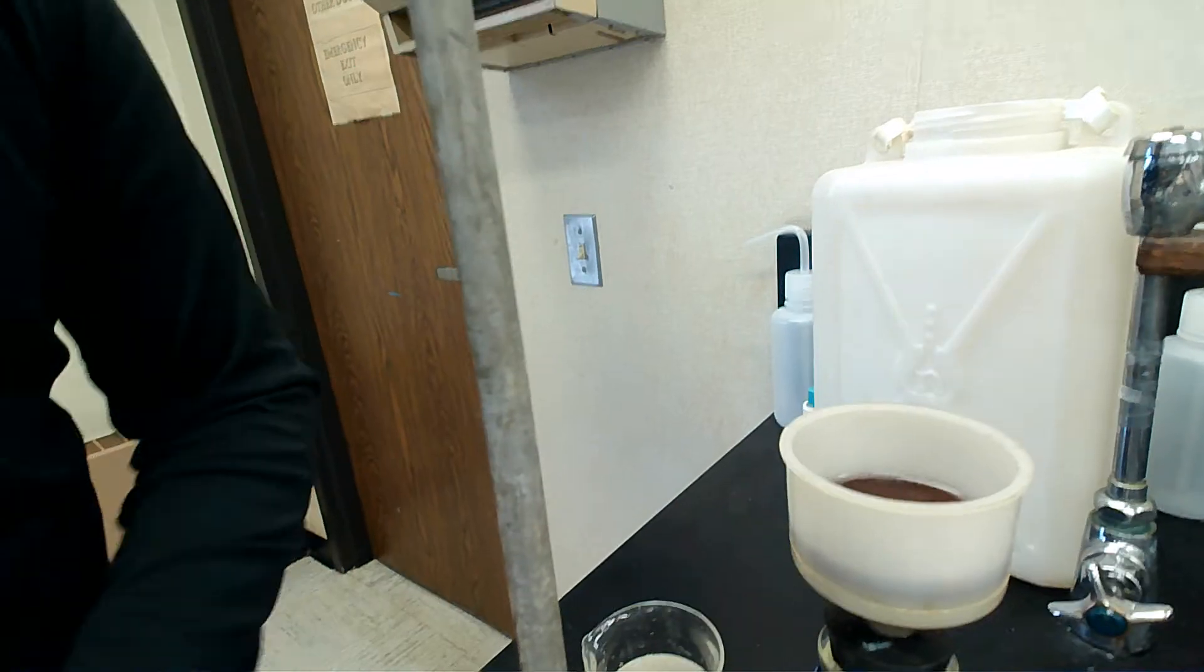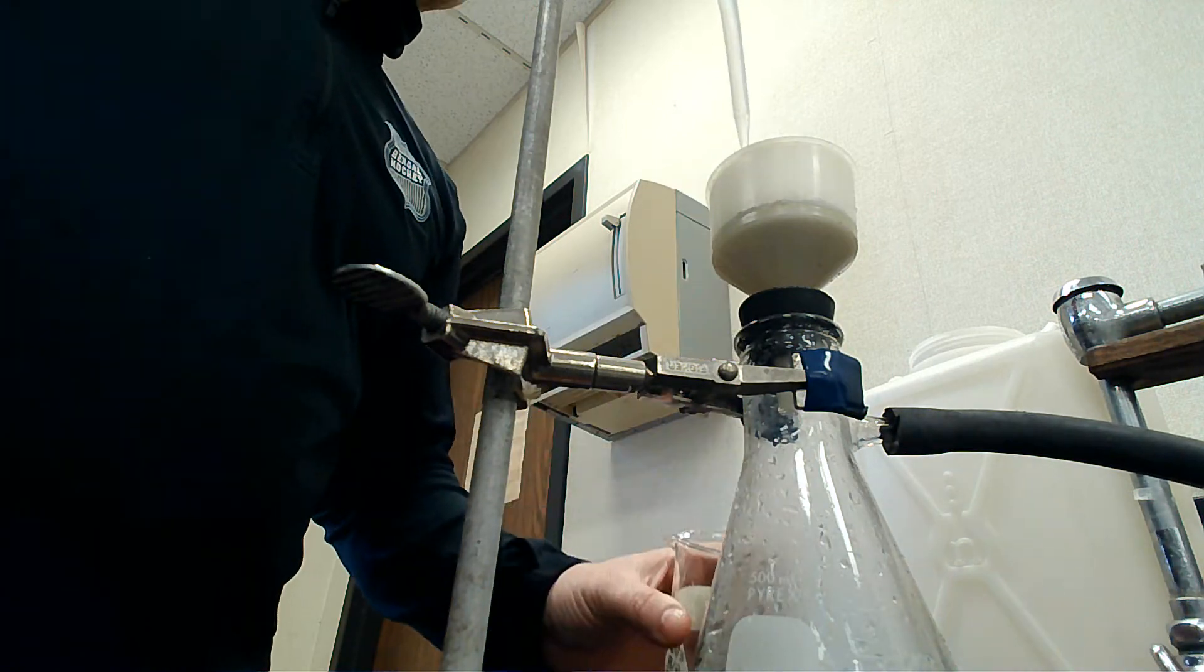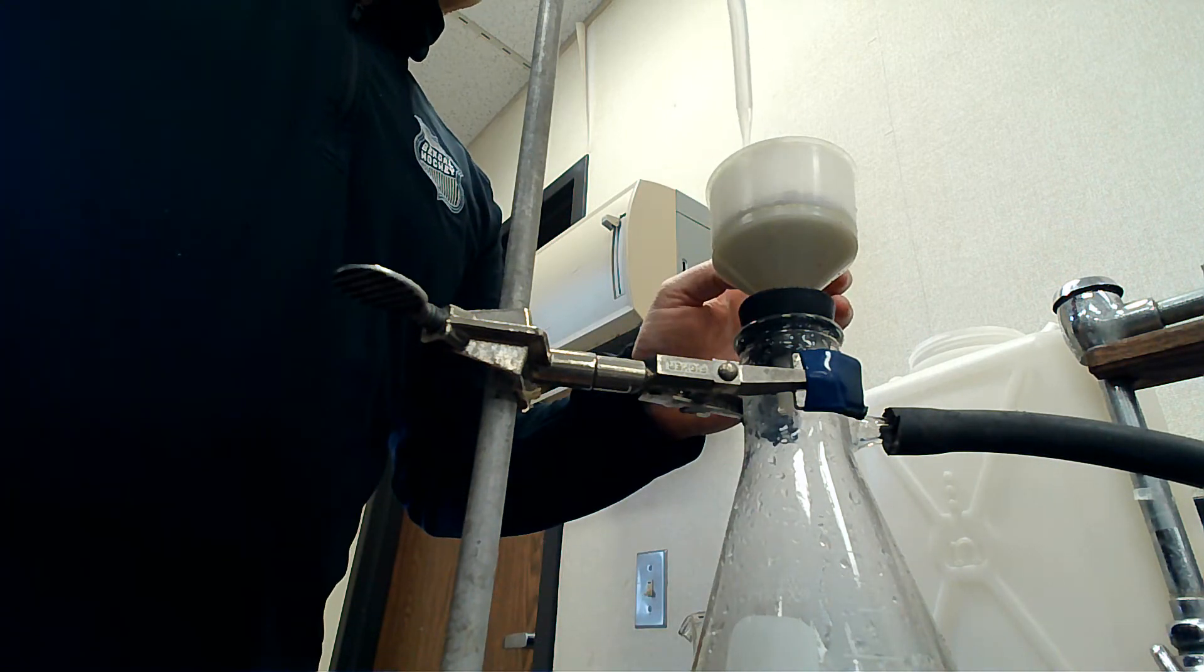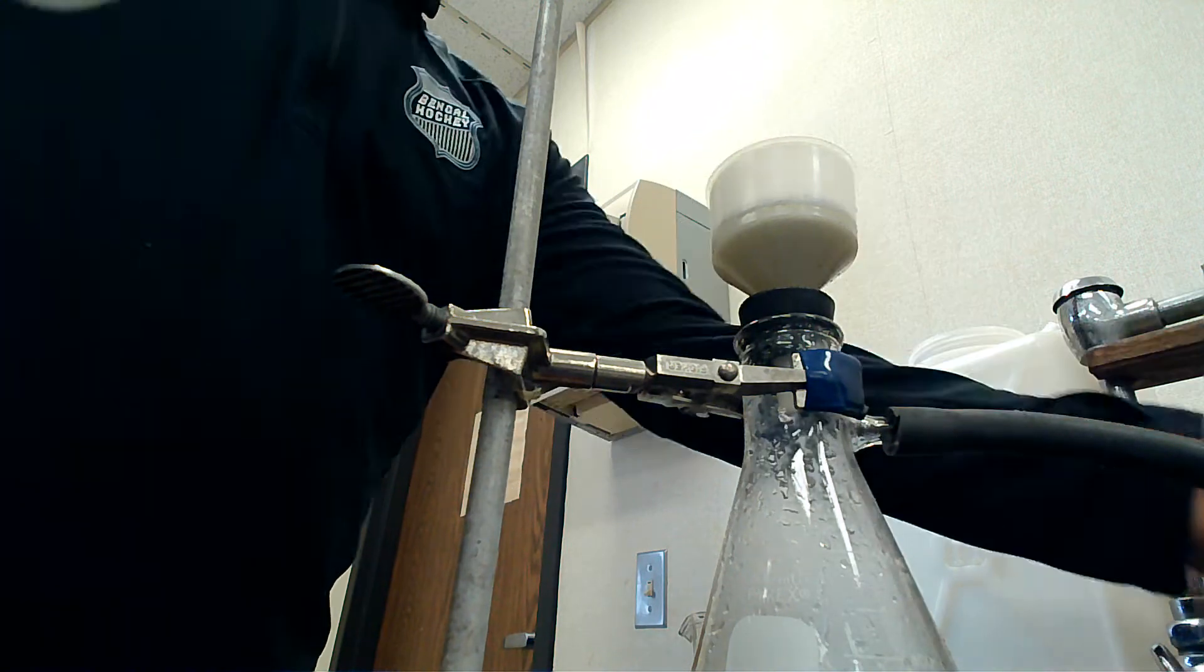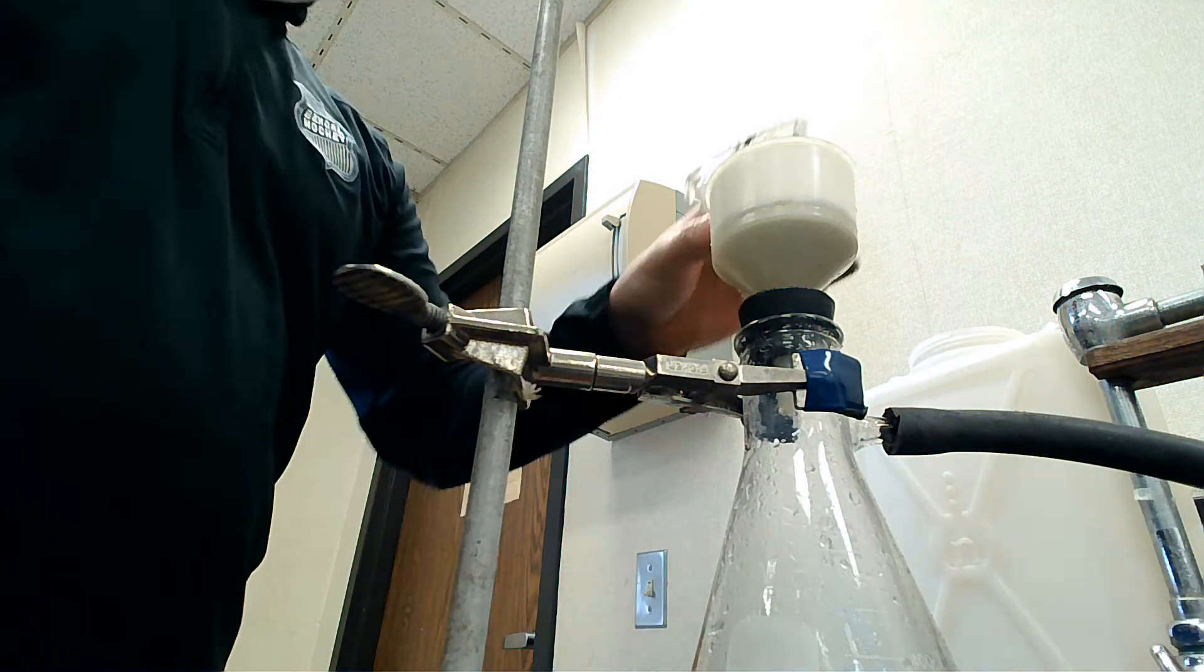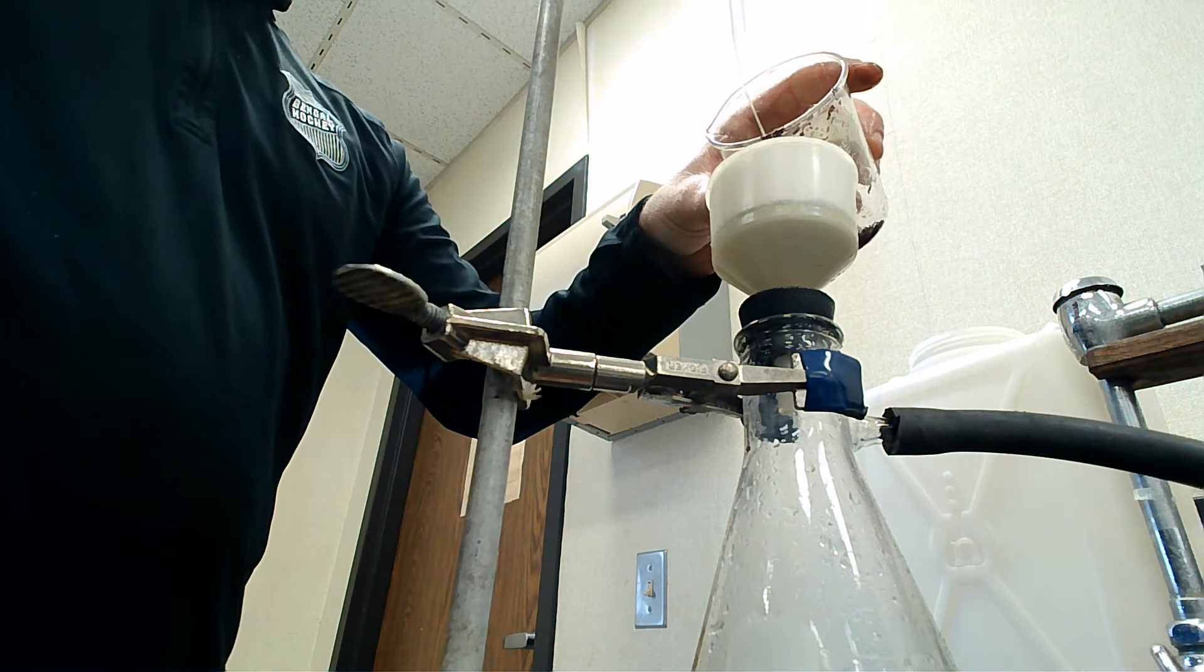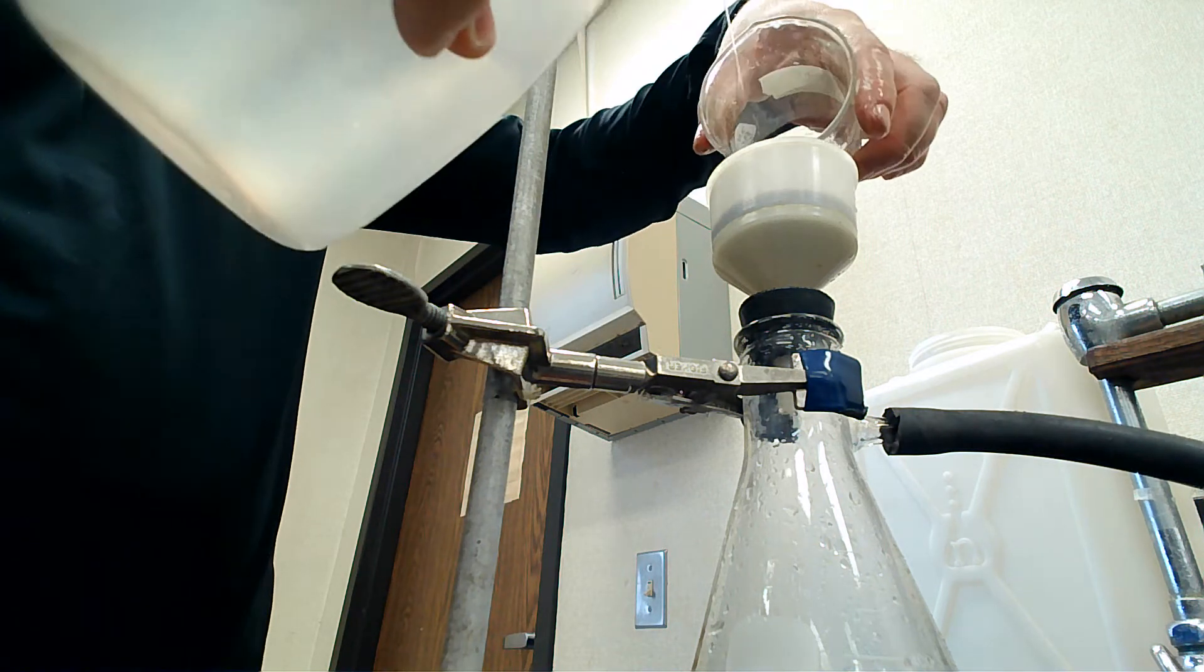That's my stir rod; I'll get that out of there. Just rinsing all the copper out.